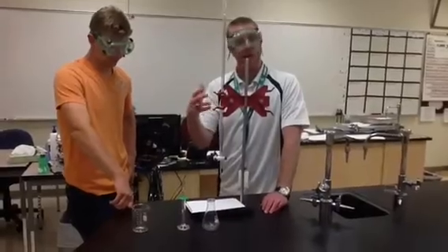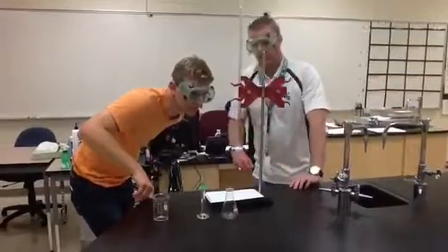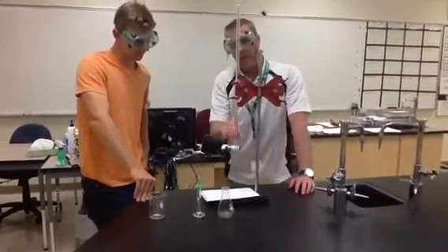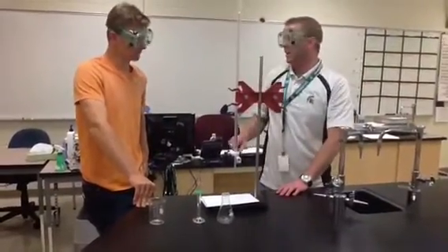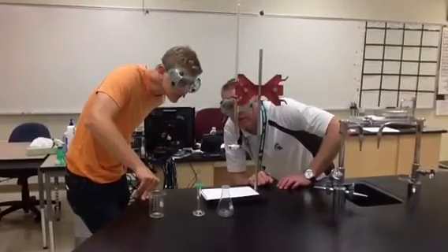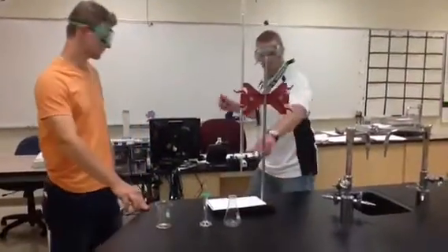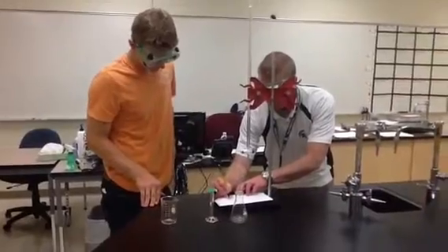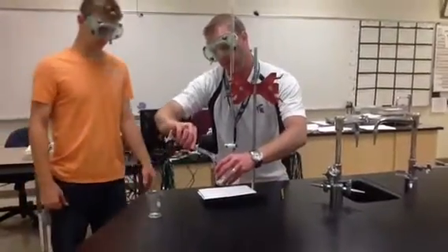That's what I want you to practice — you're going to get 5 milliliters of acid and just practice this process. I take a look at my burette. Jacob, what does that read? Between 43 and 42. Remember, it goes down to get to 50. There's a little meniscus — it's like a little bubble — and you want to read it at the very bottom. He says it's between 42 and 43, and I agree. Being more specific, I'd read about 42.6. On your little white sheet of paper, record that number — 42.6 — because that's your starting value. You then take your acid and place it inside your Erlenmeyer flask.